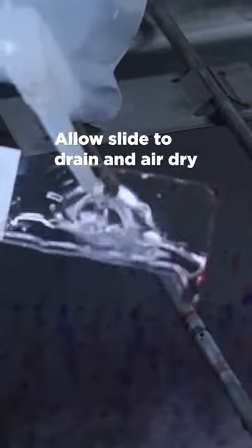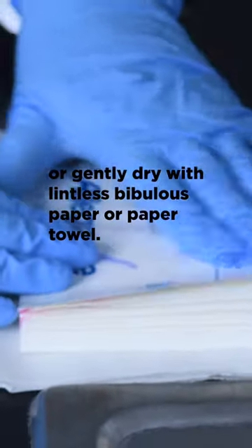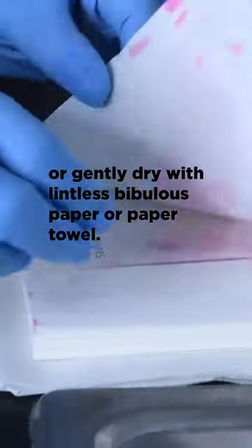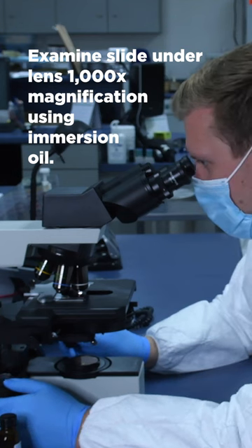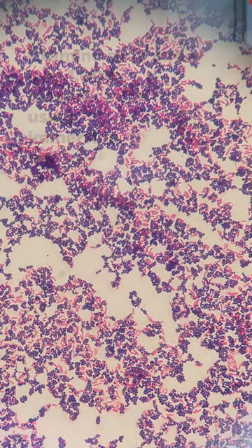Allow slide to drain and air dry or gently dry with lintless bibulous paper or paper towel. Examine slide under lens 1000x magnification using immersion oil.